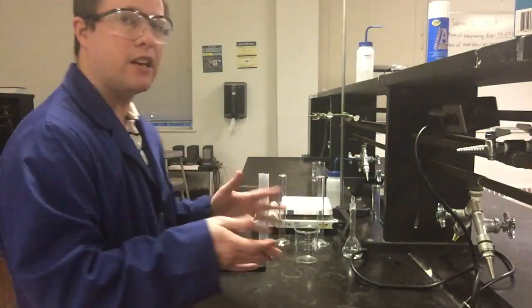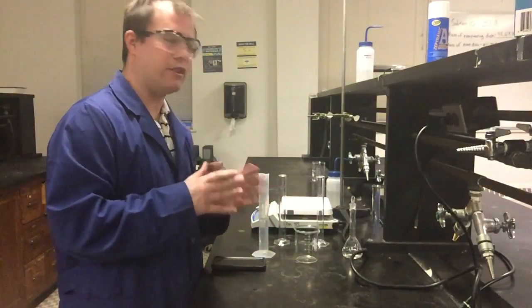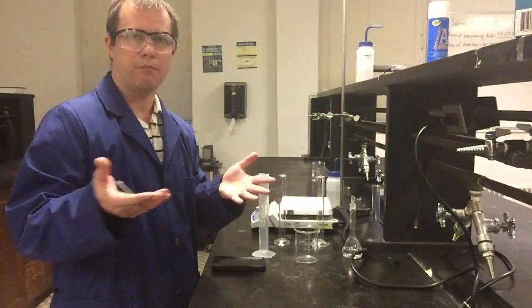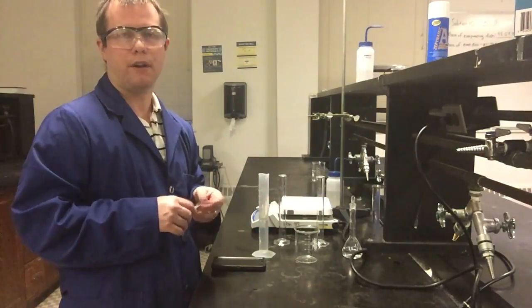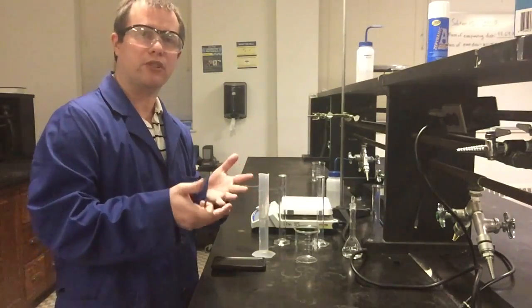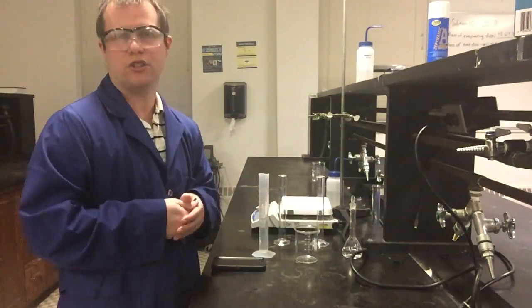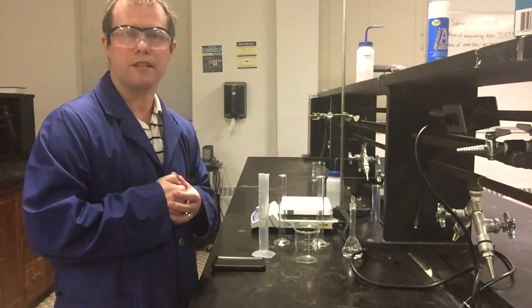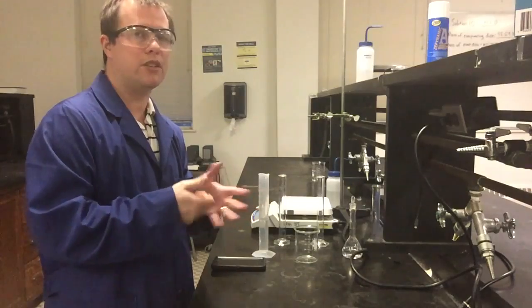In terms of cleanup, usually for this lab, once the acid and base have reacted, HCl and NaOH, with very similar concentration, pretty much the product that's left is just sodium chloride, table salt. So actually everything for this lab, as long as it's all been neutralized, can usually just go down the sink with a little bit of water just to dilute anything that maybe wasn't fully neutralized for any reason. So pretty easy cleanup on this one.